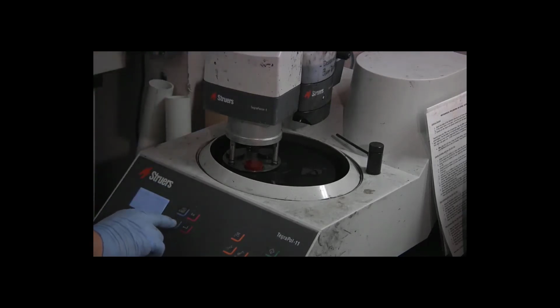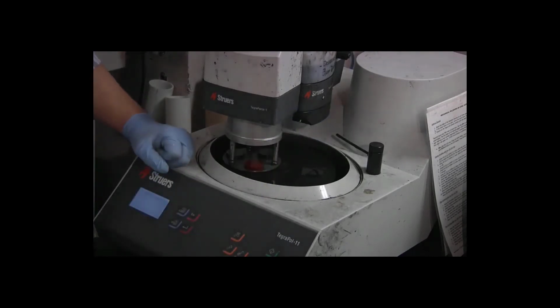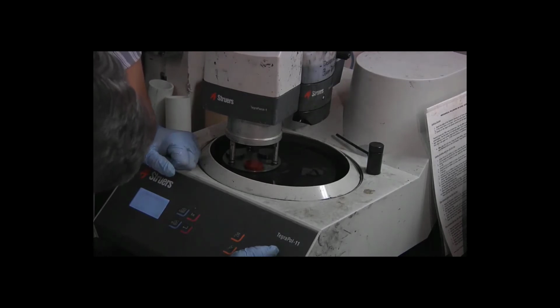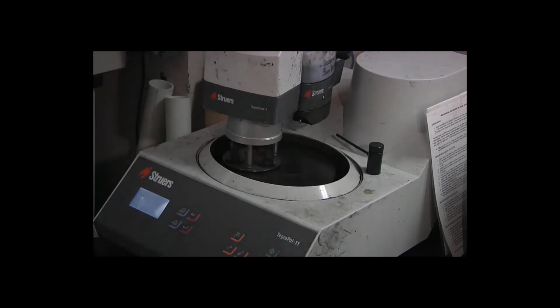So again, I need to select the doser level, press enter, use the arrow keys to bring the doser level down to 4, press enter again. So now we have doser number 5. It's recognized the new bottle. The level is set back to 4. And I want to watch the nozzle as I press start to watch for a drop of material. And I did get a drop of material, so we're good to go.